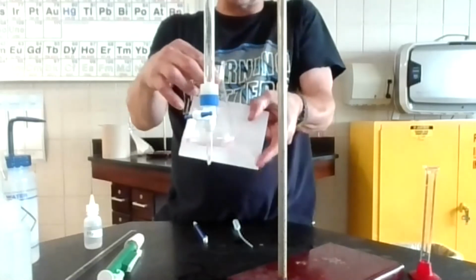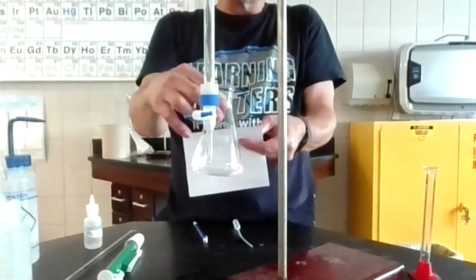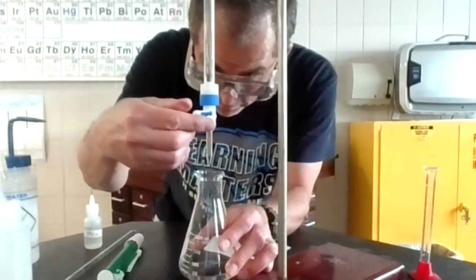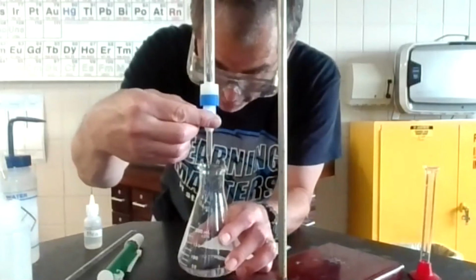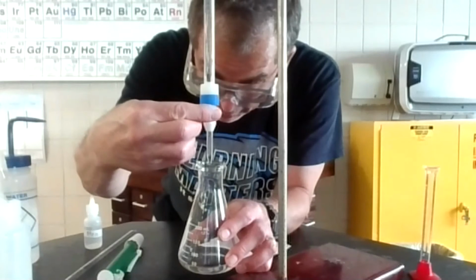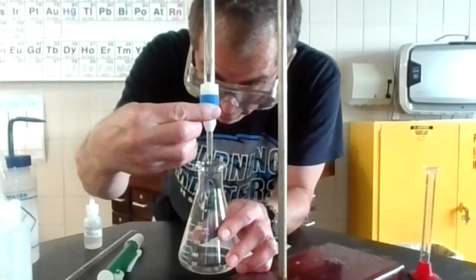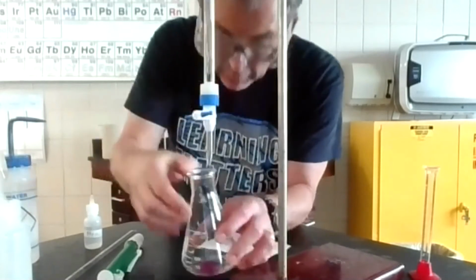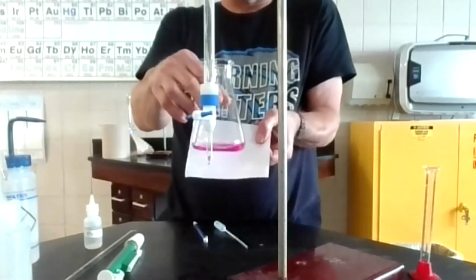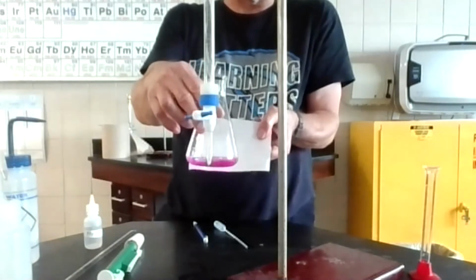Okay, you may or may not be able to see that faint pink. You know, if I'm like, I think that's probably right on. I'm going to just put 1 more drop in for good measure, but after I just read it. So I just read it. Okay, I'm going to add 1 more drop just to see what that looks like. And to me, that probably looks like an over titration, but how much is it over? It's 1 drop, so you'd still get an accurate measure reading it from right now.